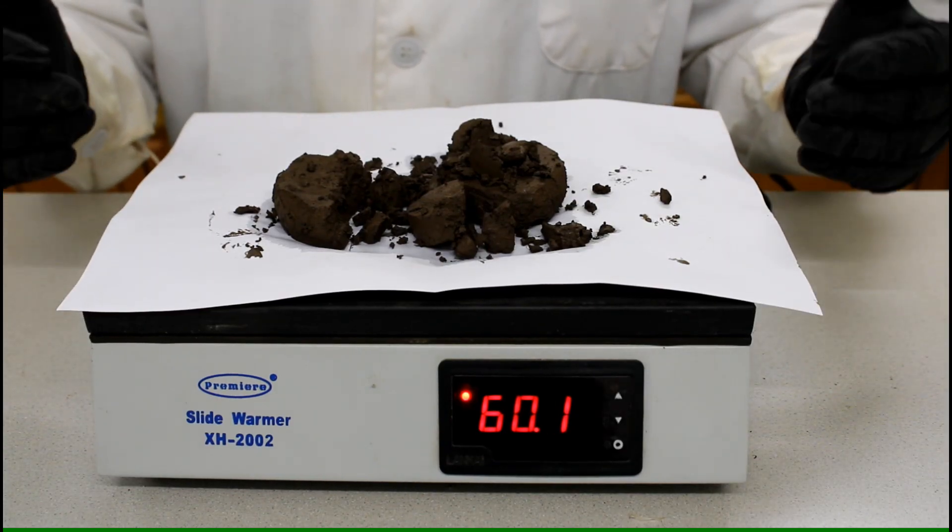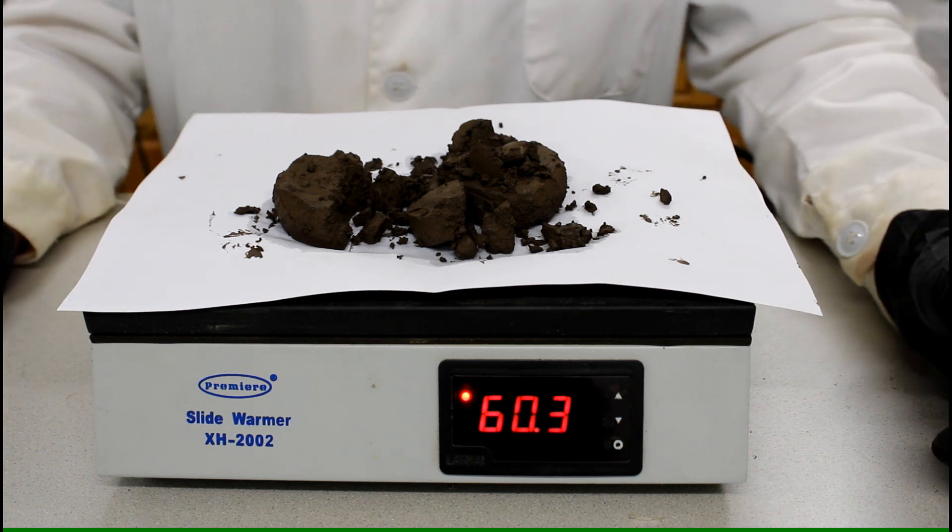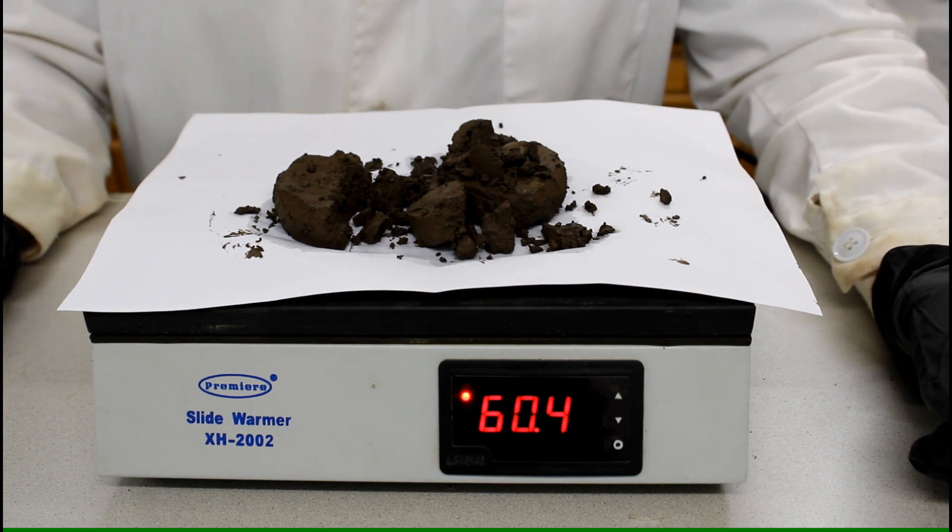So this brown blackish sludge that you can see here is our final product. It's the silver oxide.